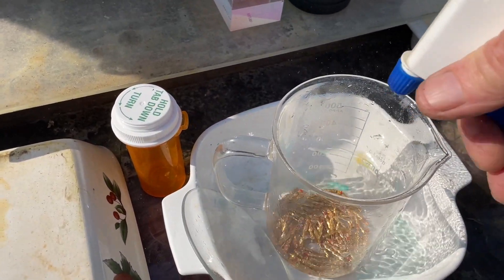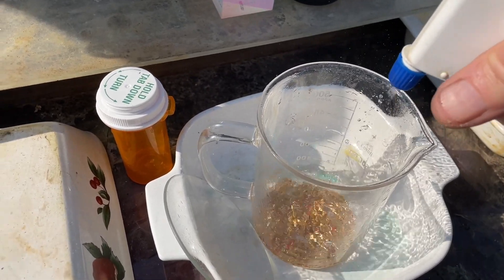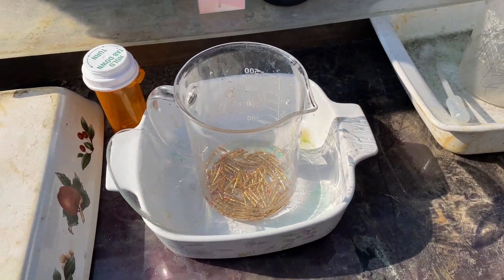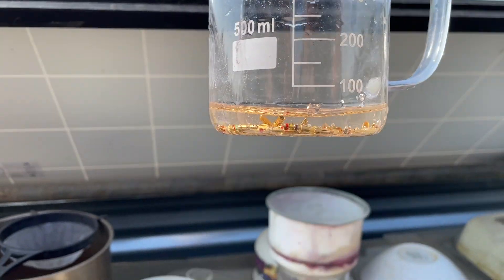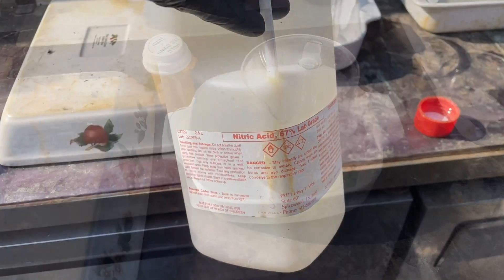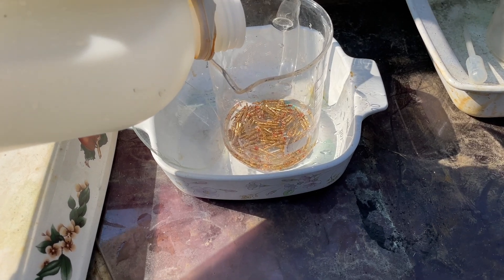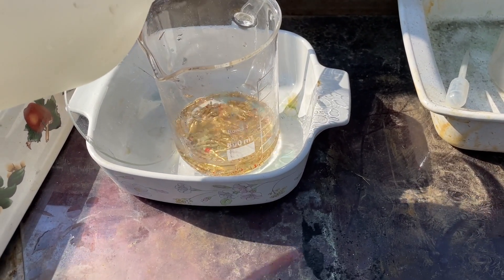I'm gonna add very little water — I'm trying to run these things hot. That's about 50 milliliters. All right, get some gloves on here. We'll add a little bit of nitric acid. You got some concentrated nitric acid here folks. I'm gonna do this one about 50-50 maybe. Let's see how she goes.